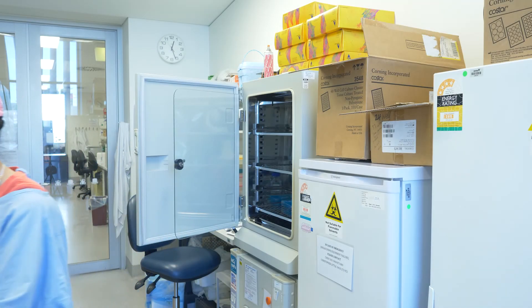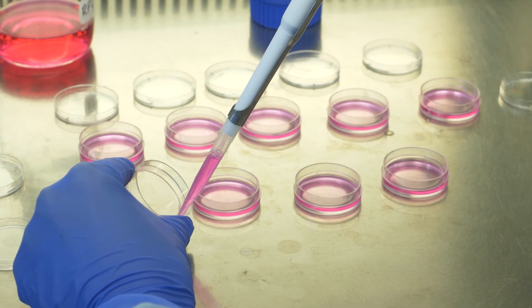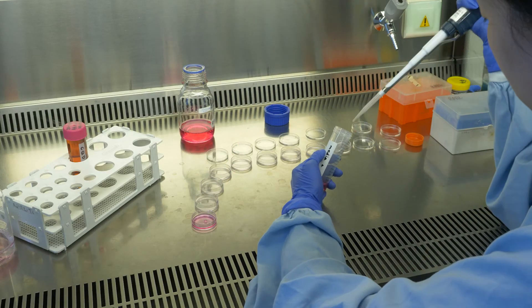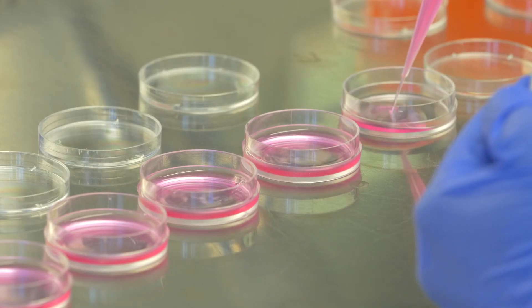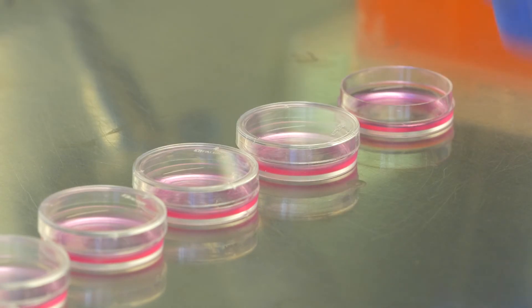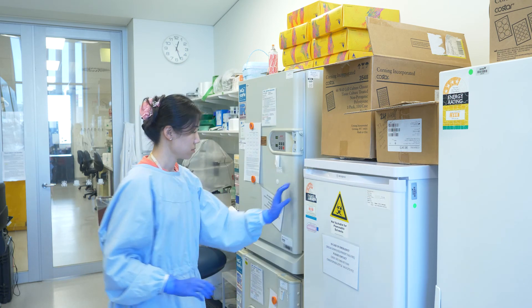It has been 24 hours and the cells have attached to the bottom surface of the dishes. We take out the media and discard it in the bleach, which decontaminates waste medium before disposal. We have prepared fresh media containing a specific concentration of carbon quantum dots — in other words, we mixed the carbon quantum dots with the culture media. Now we are transferring 1 ml of the media containing carbon quantum dots to all the dishes. Due to their rapid cellular uptake properties, the carbon quantum dots will be taken up by the cells.